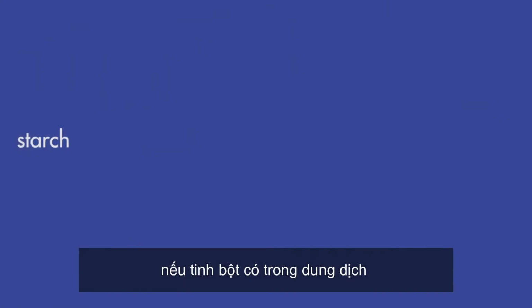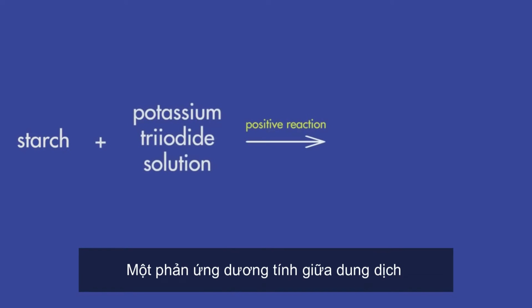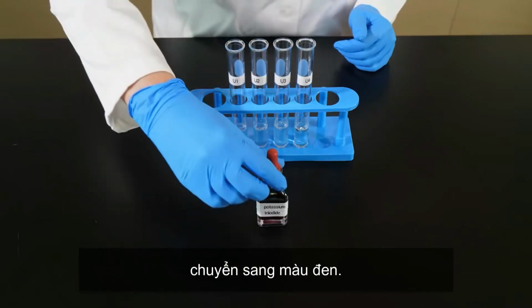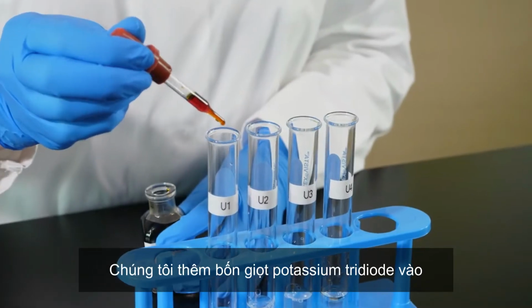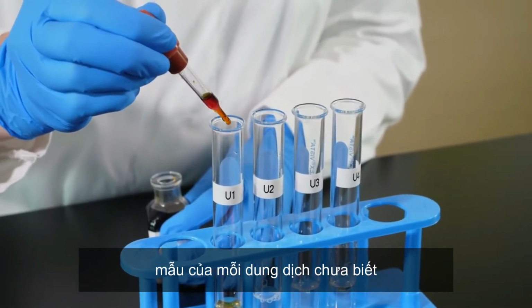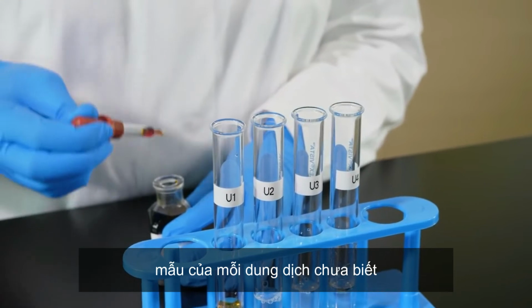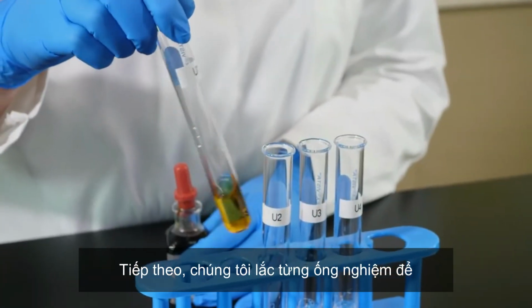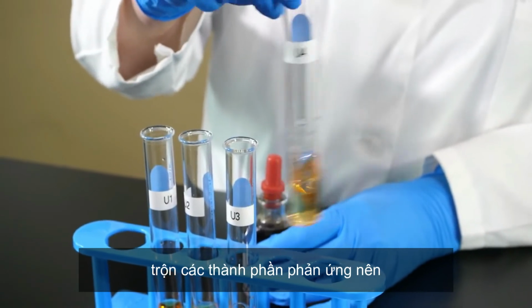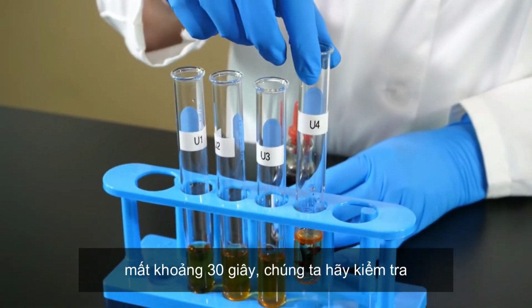If starch is present in a solution, a positive reaction between potassium triiodide solution and starch will occur, and the solution we are testing will turn black. We add 4 drops of potassium triiodide solution to a sample of each of the unknown solutions. Next, we swirl each of the test tubes to mix the contents. The reaction should take about 30 seconds.